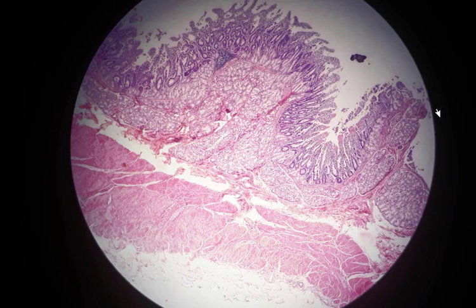First, as you can see here, the entire mucosa is thrown into the deep folds called plica circularis, which run circumferentially or spirally. The plica circularis are visible at the low power on this slide. Plicae begin in the distal duodenum, reach maximum size in the jejunum, and begin to diminish in the ileum, and then are nearly absent in the distal ileum.